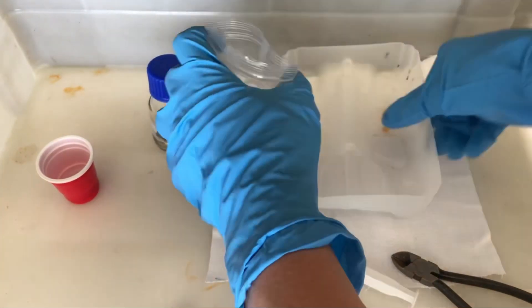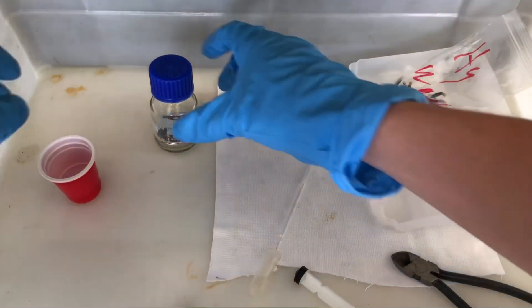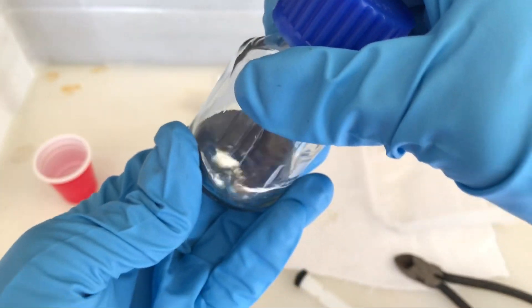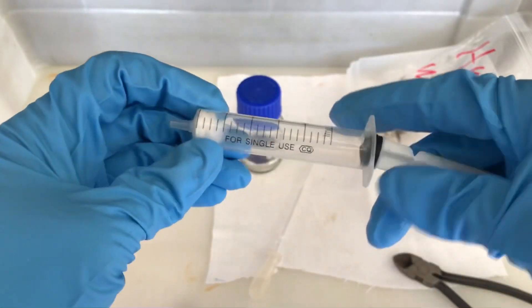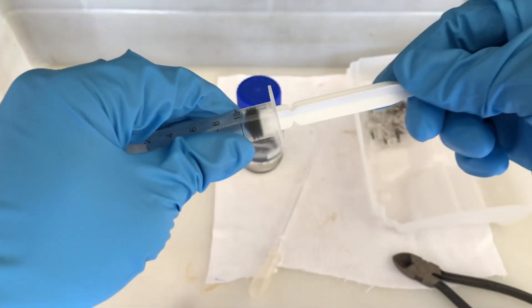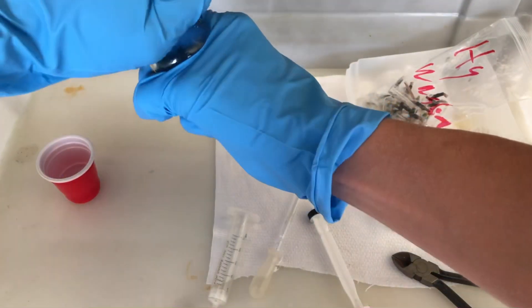You may remember that I used a pair of pliers to break open the ampules. There's still some glass and mercury on them, as you can see, and we have to get rid of these glass shards. A nice and easy method that has proven to be extremely valuable is to place a bit of cotton wool into a syringe, fill in the mercury, and filter the mercury through the cotton.